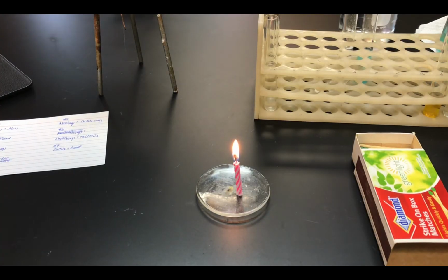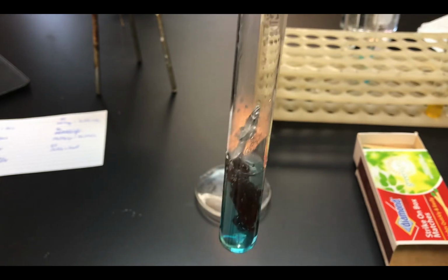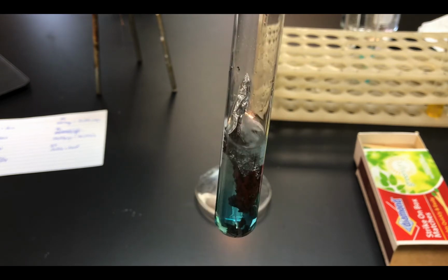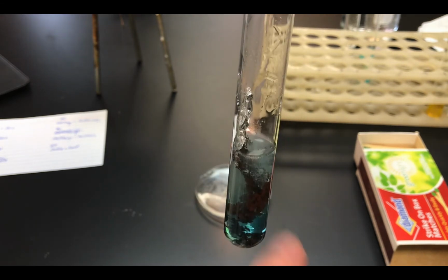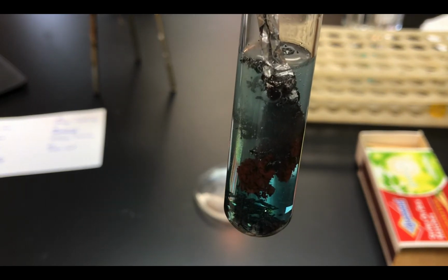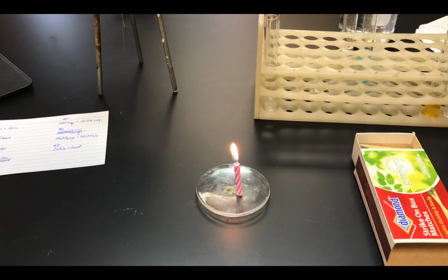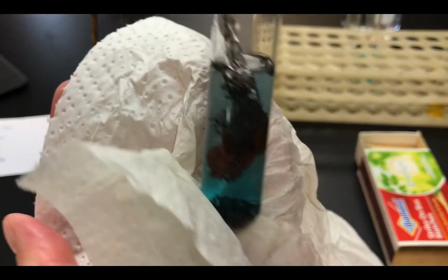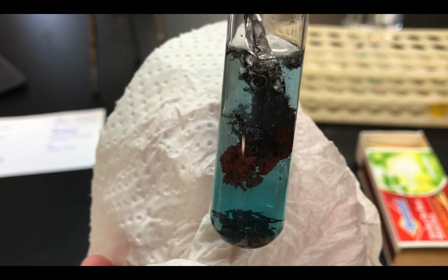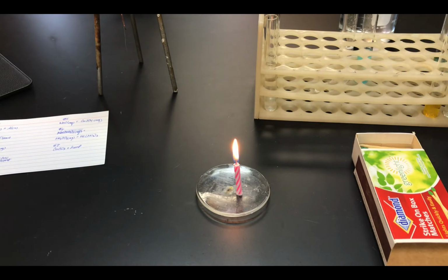Revisiting demo 1 and 2, there's the candle, new observations. There is the aluminum in the aqueous copper chloride. Note that we tapped the test tube and something happened, so take note of that. Now, just to make sure that we are observing any color changes appropriately, we are going to put a white background against the test tube so we can keep track of colors that might be happening in the test tube, right? Now, obviously, we're just trying to maximize the color difference. So if we were forming a white precipitate, for example, then putting it against a black background might be more helpful than a white background, right? So here's where our art knowledge comes into play.